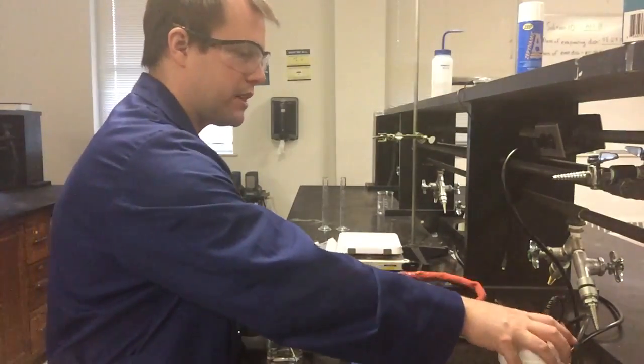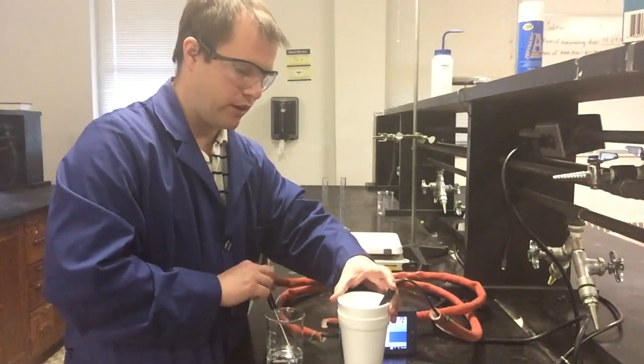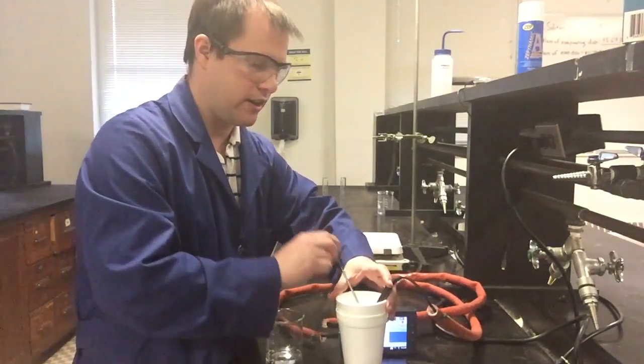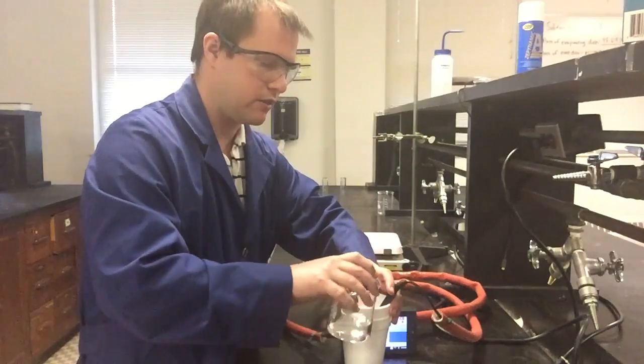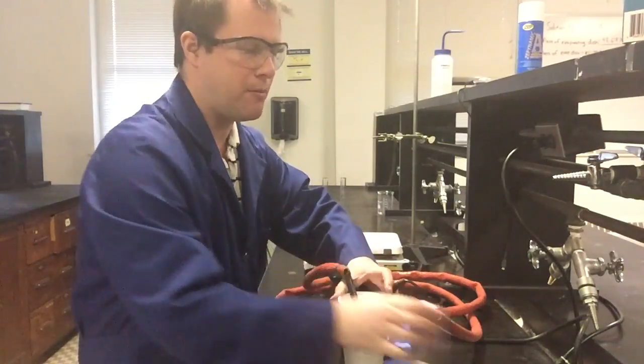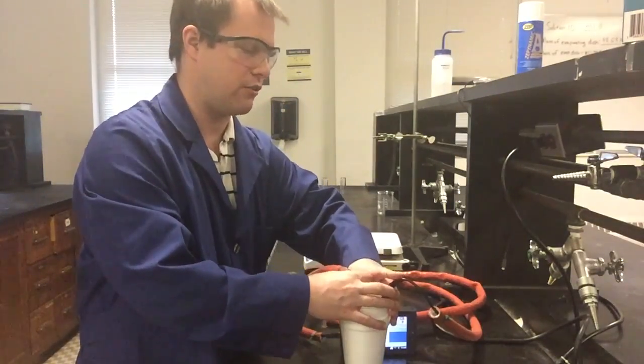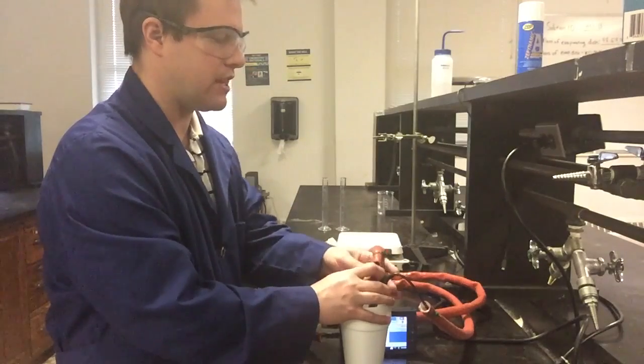So what I'm going to do to mix these two solutions is bring my cold water solution over, because that's what I'm going to be pouring everything into. And I'm going to put my thermometer in there for the other one quickly and mix all of this together. And so I've added my hot water to the cold water. It's important I did it in this order so I keep everything in this particular styrofoam cup. And this is where I'm going to keep everything.